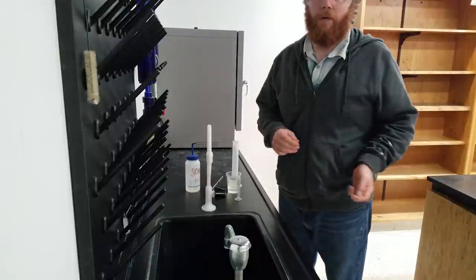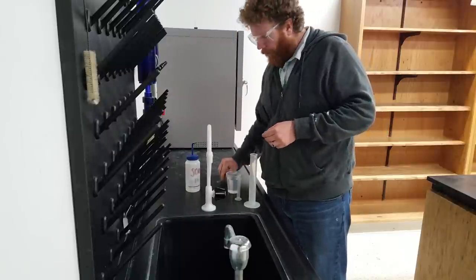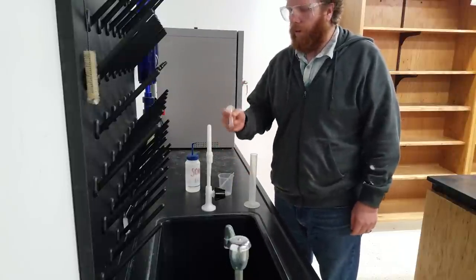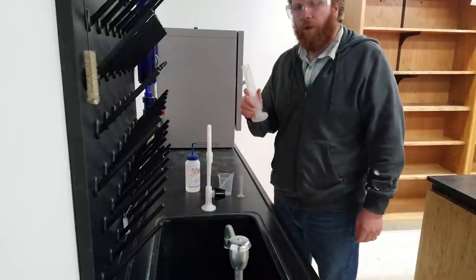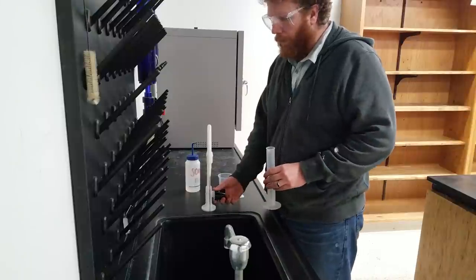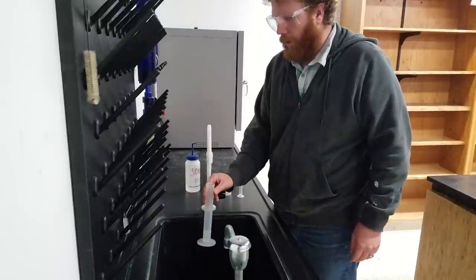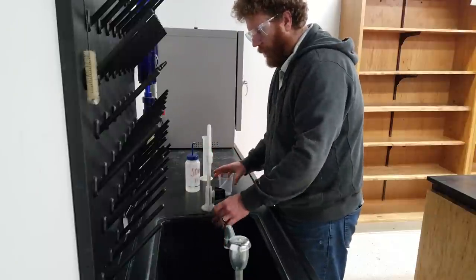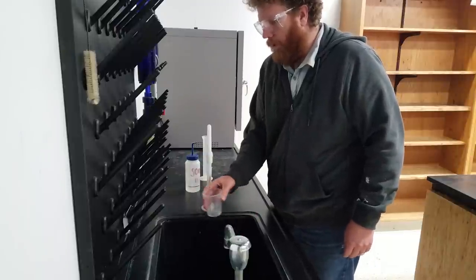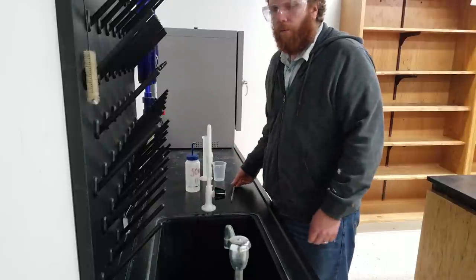This first week's lab cleanup is fairly simple. There are basically four pieces of glassware that came into contact with water: the 110 degree thermometer, the 250 milliliter beaker, the 10 milliliter graduated cylinder, and the 100 milliliter graduated cylinder. Pour any excess water down the drain. Anytime you use any piece of glassware, you always want to triple rinse it with deionized water. Fill it up partway, empty it out — repeat three times. Do the same for the 10 milliliter graduated cylinder, the 250 milliliter beaker, and run the thermometer under the water a couple of times. Now we're all done with the rinsing portion.